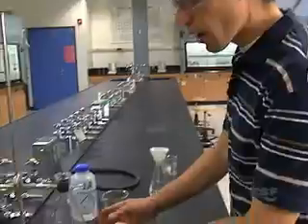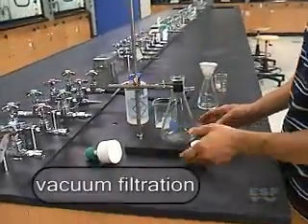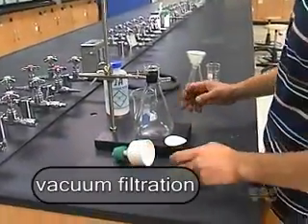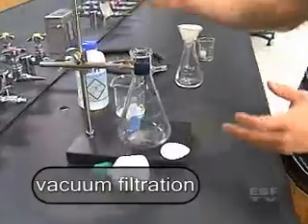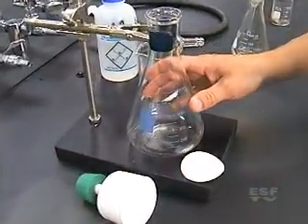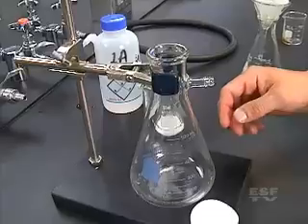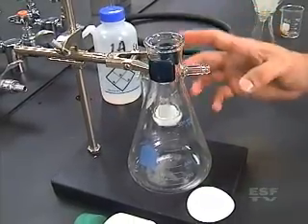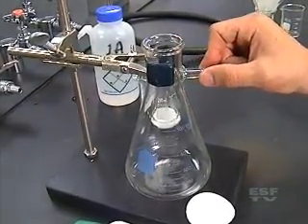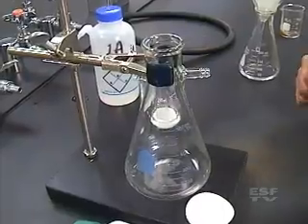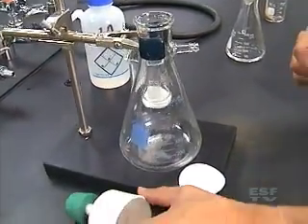So if we look at our vacuum filtration there's a few more pieces that we need. First we have our ring stand and our filter flask. And our filter flask needs to be clamped into our stand so it doesn't fall over. And it looks much like an Erlenmeyer flask with a small tip and that's for receiving the vacuum line. We of course have another funnel.